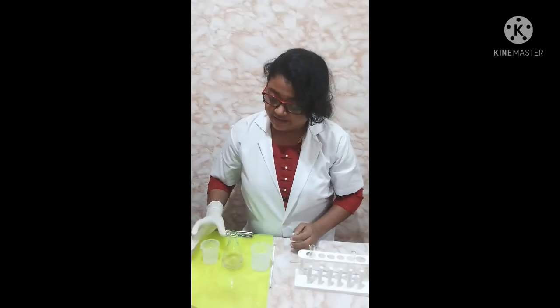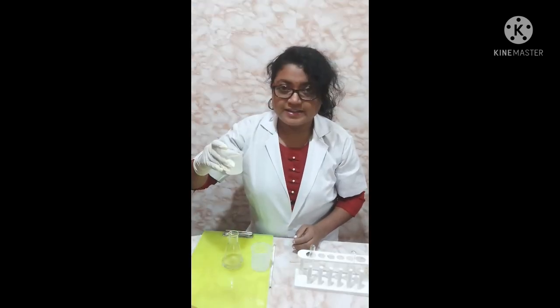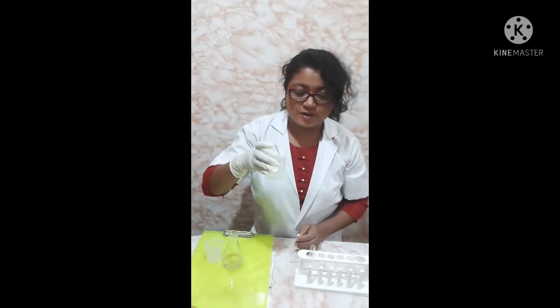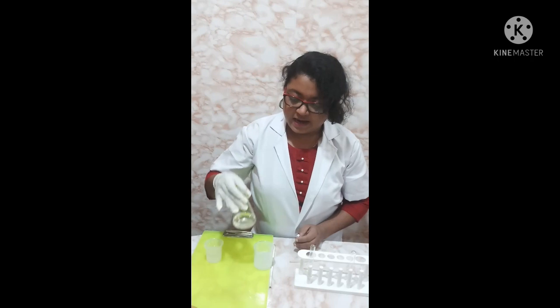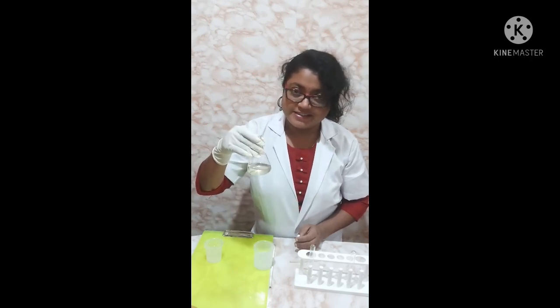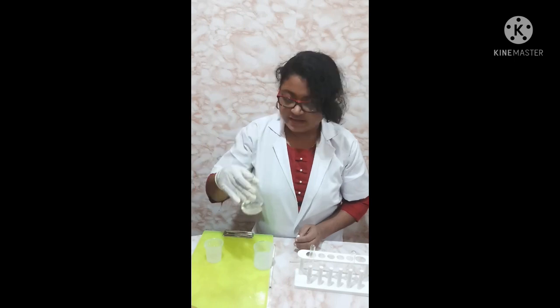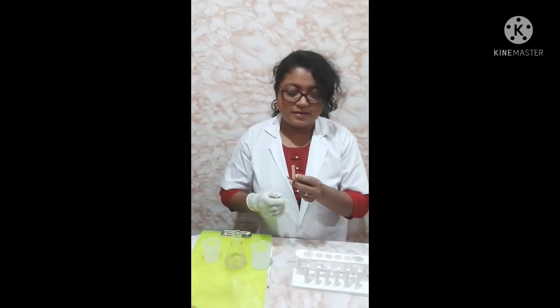Here I have three different test solutions. This is lime juice — lime juice is an acid. This is soap solution — soap solution is a base. And this is salt solution — salt is neither a base nor an acid; it is a neutral solution.